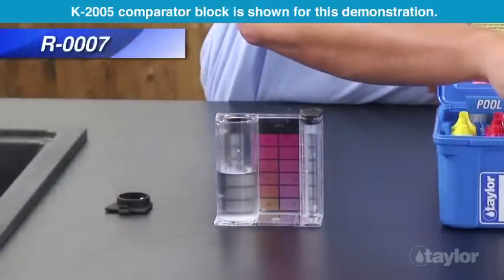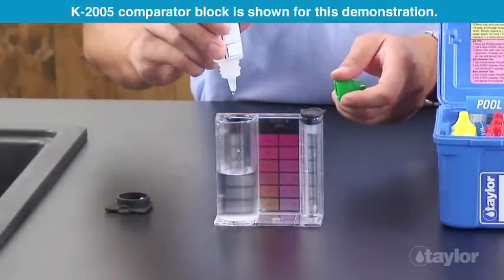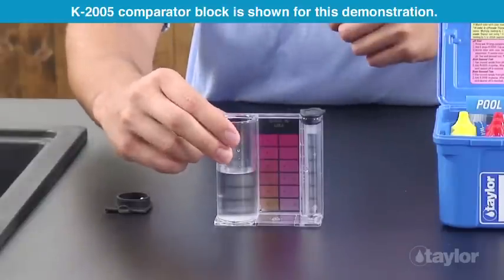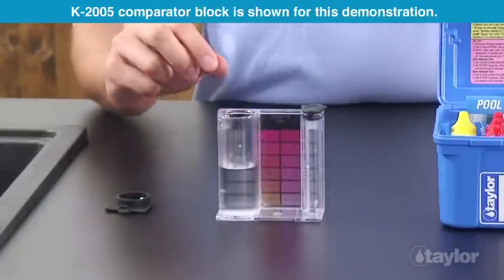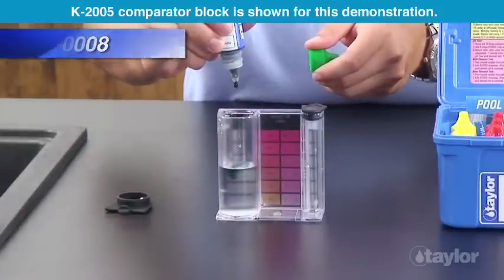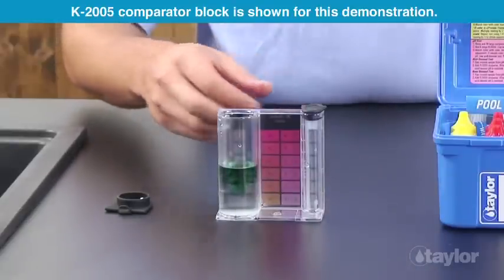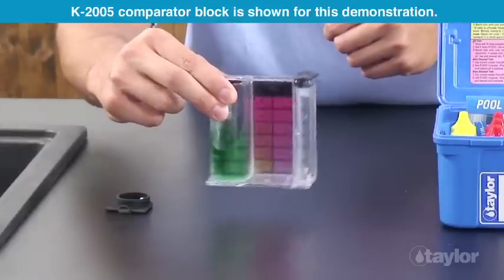Add two drops of Reagent 7 and swirl to mix. Add five drops of Reagent 8 and swirl to mix. The sample should turn green.